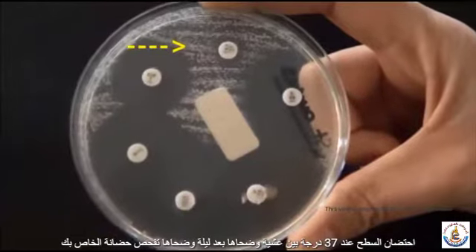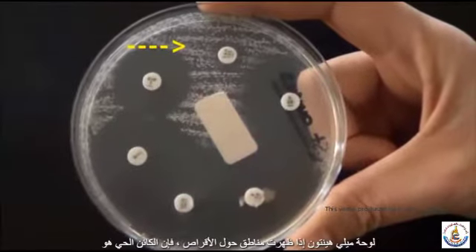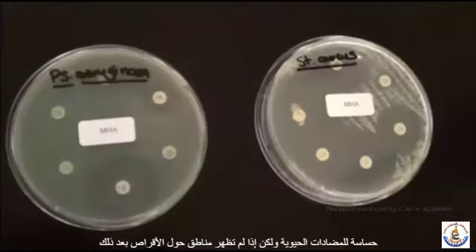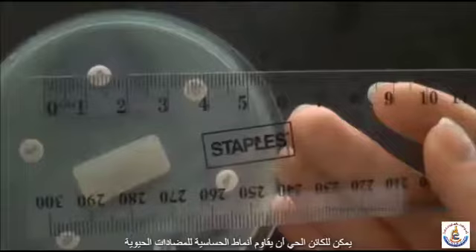After overnight incubation, examine your Mueller-Hinton plate. If zones appear around the discs, then the organism is sensitive to the antibiotic. However, if no zones appear around the discs, then the organism is resistant to the antibiotic.